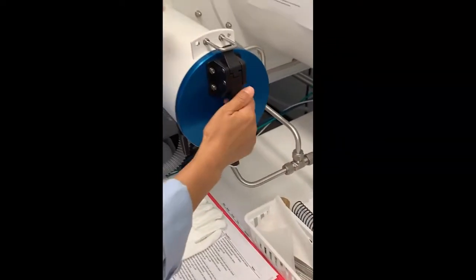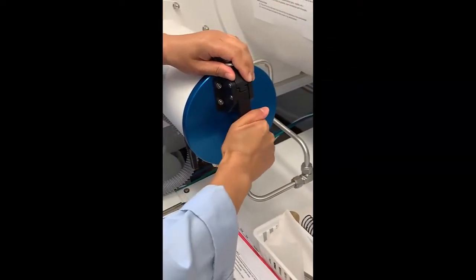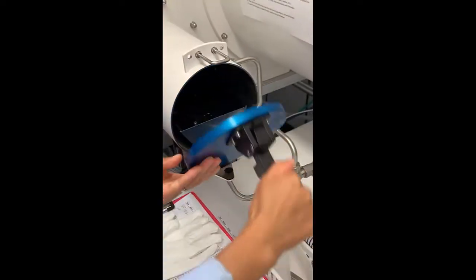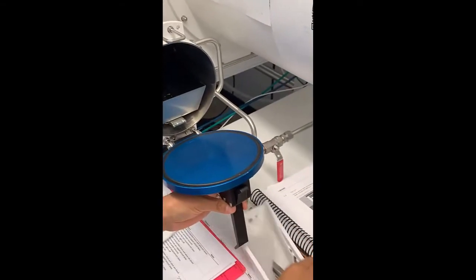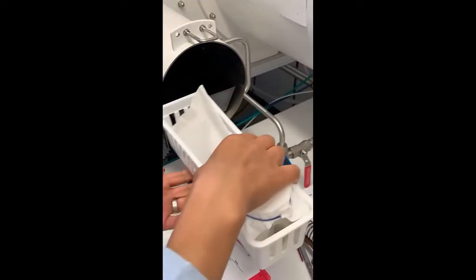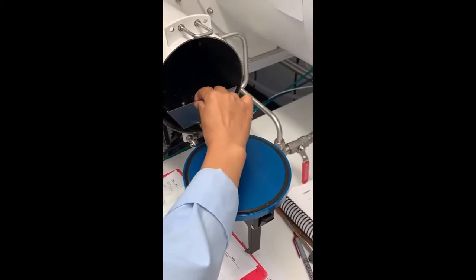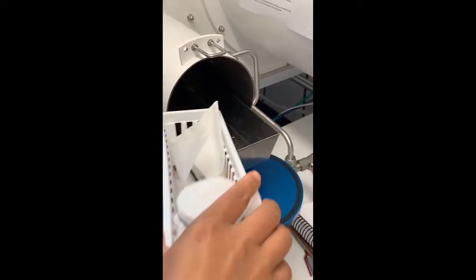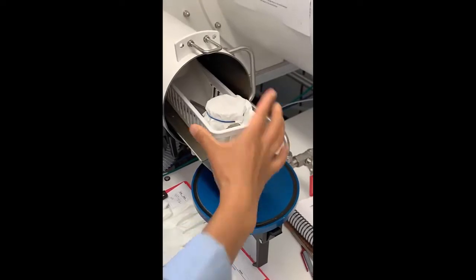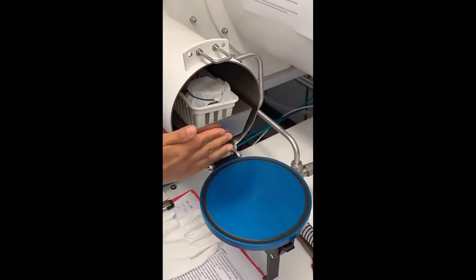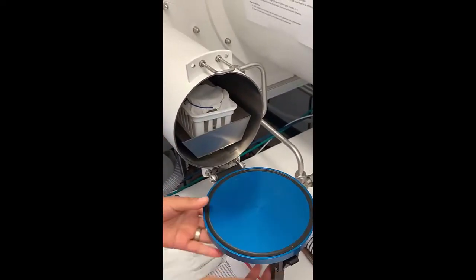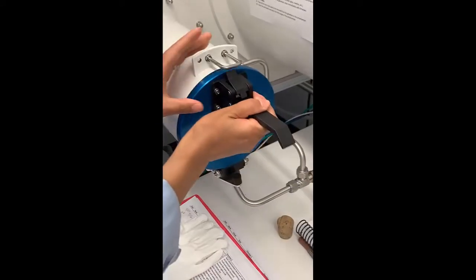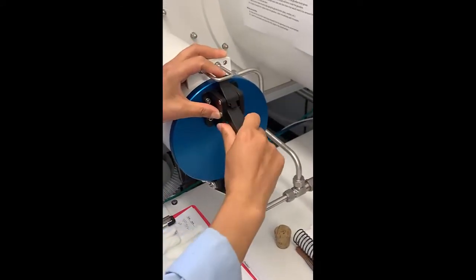Then you open the antechamber by pulling on the black lever. You place your basket of accoutrement inside after sliding out the internal tray. Replace the internal tray and close the antechamber door. Make sure to close the black lever.